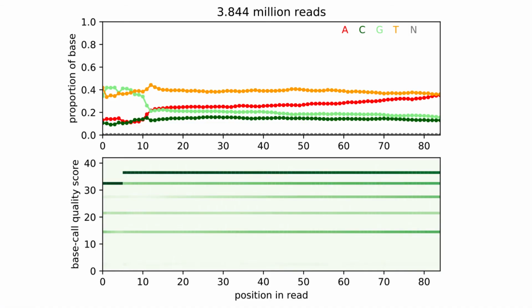While previous examples were rather unproblematic, this case raises some concern. The proportion of each base is expected to remain relatively constant over the length of the read. Moreover, complementing AT and CG bases should show matching lines. Here, we see a clear imbalance in the base proportion.